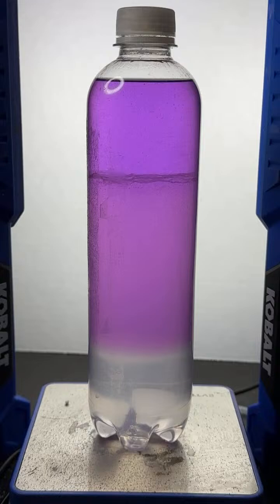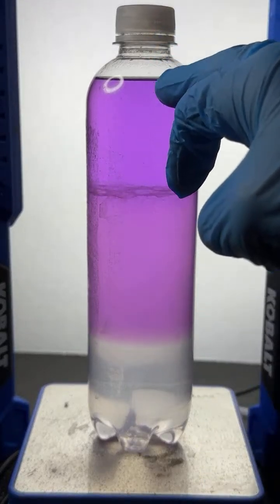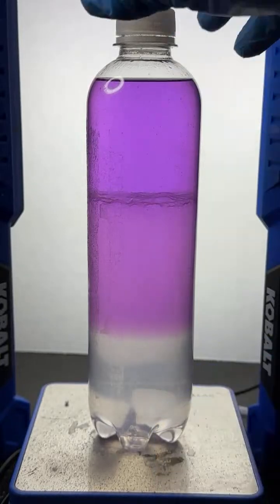There you go, Alex. Okay, so we can see the emulsion layer here. We can see the alcohol layer here, and we can see the saltwater layer. I'm going to zoom in on this because I like seeing the top of the emulsion layer. So we're looking at the interface between the alcohol and the emulsion, and that top, to me, it always looks like clouds to me. It's very interesting.